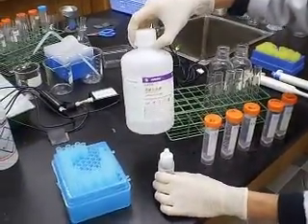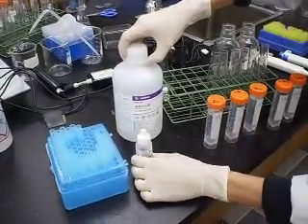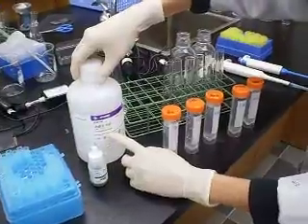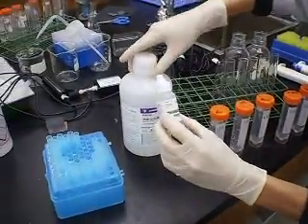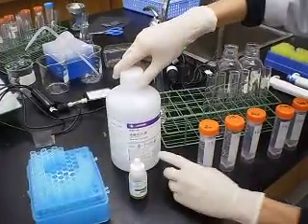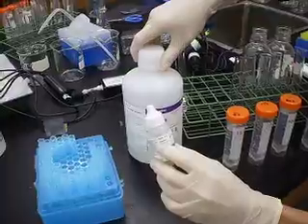So I have hydrogen peroxide with me and this is enzyme catalase. Our research question is how will changing hydrogen peroxide concentration affect the rate of reaction and the gas which is produced will be oxygen. Because when hydrogen peroxide reacts with catalase, oxygen gas will be produced.